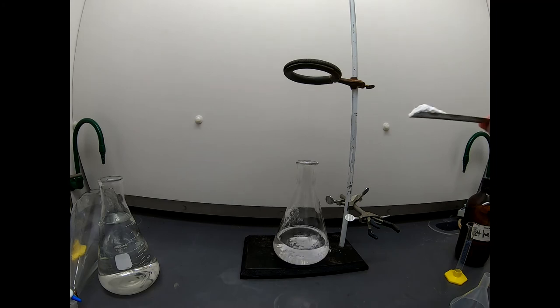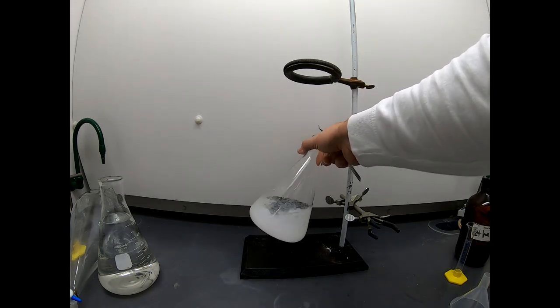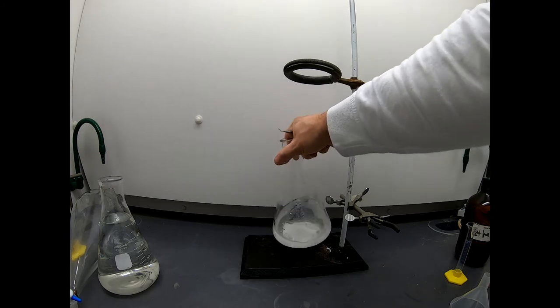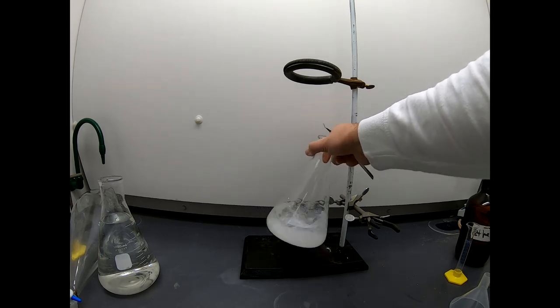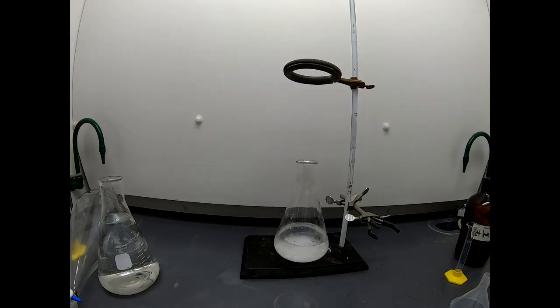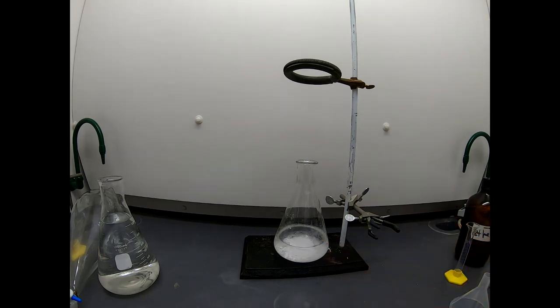So I'm going to add some drying agent to this. This is not a precise process. We just want to add some drying agent. This is magnesium sulfate. What this does is it chemically binds the water on the magnesium, and that removes it from our ether solution. You might say, well, great. Now instead of getting rid of water, we got to get rid of the magnesium sulfate. You're right. We do. But this is pretty easy just to filter away. And once we filter it away, we'll be left with ether, which contains hopefully just our product, maybe impurities, but basically just our product. So we'll let that dry for a second. It's very fast, and then we'll come back and we'll do a filtration, and we'll start to think about how we get rid of the ether.